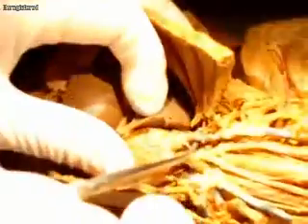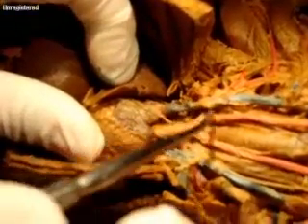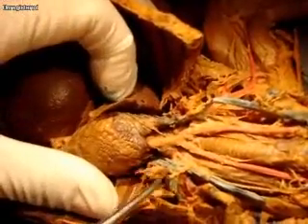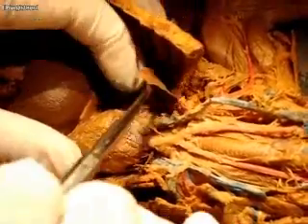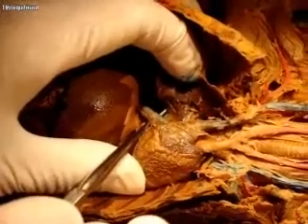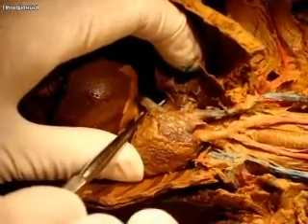This is the internal thoracic right here coming off of it, and then this is the right cranial vena cava. This is the left cranial vena cava coming from up above. And then down at the bottom of the heart, this one here would be the caudal vena cava, which in a human you would call the inferior vena cava. So there's actually three of them.